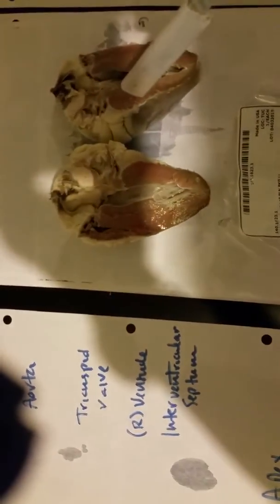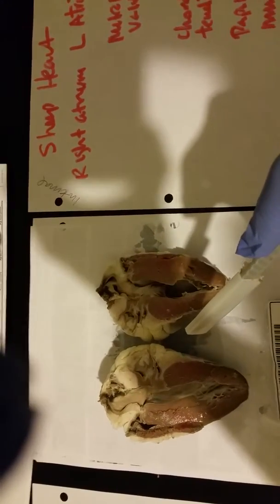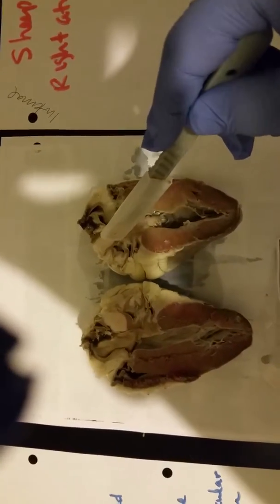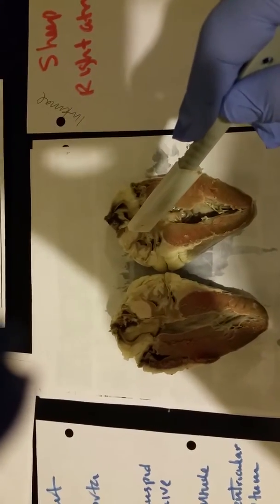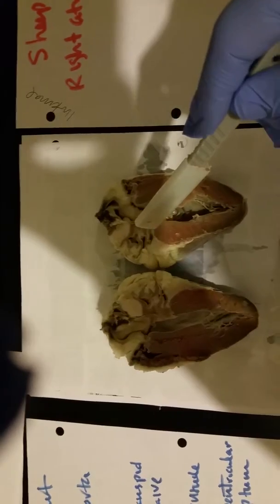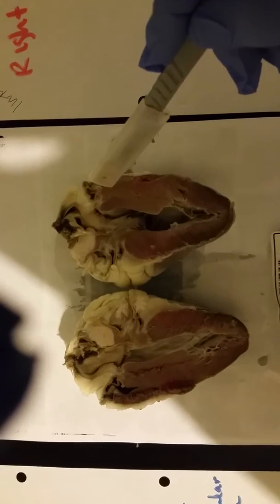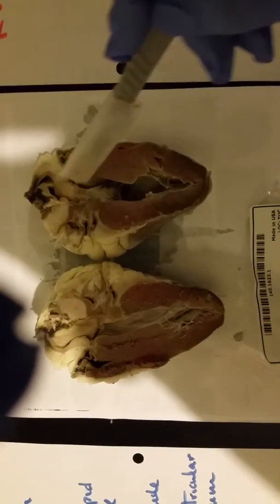So moving over to the other side, we are able to get more detail because we know that the atrium, which is right here, is able to tell us which side is the oxygenated and the deoxygenated side. And again, as review, we know that we are pumping from right to left, deoxygenated to oxygenated. So then we're able to get a clearer view of the left atrium and then our mitral valve right here, this little groove right here.